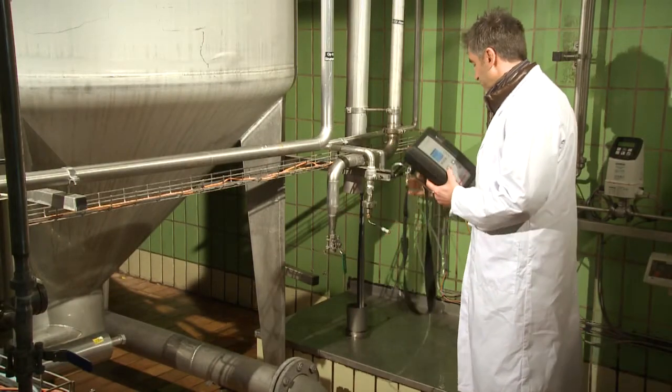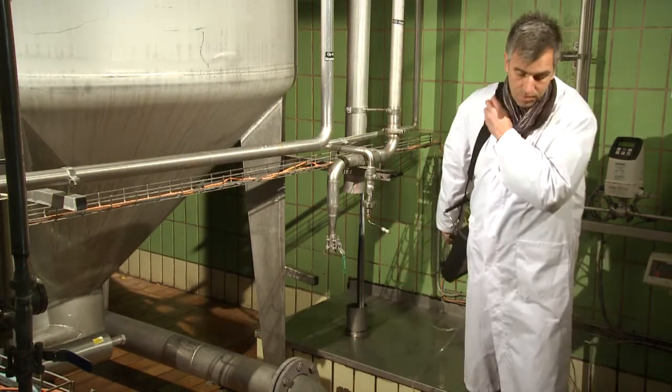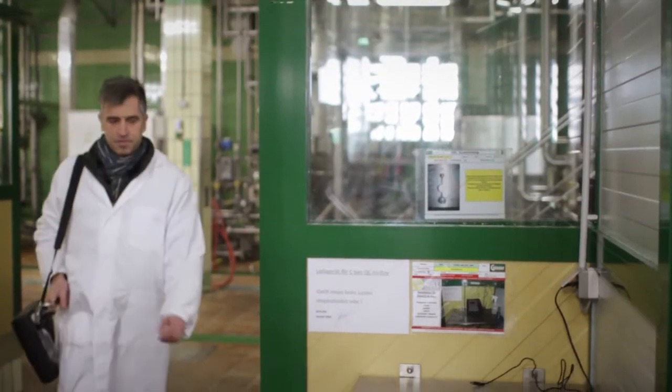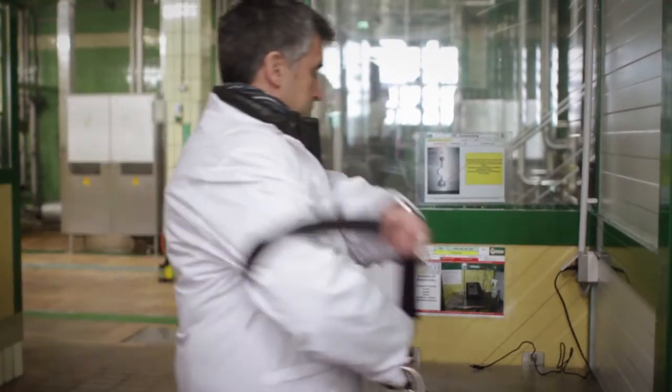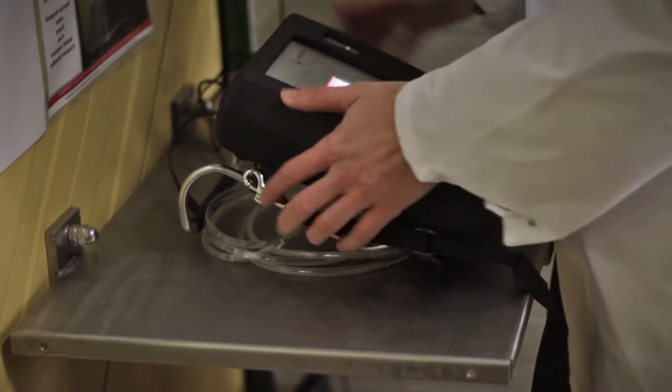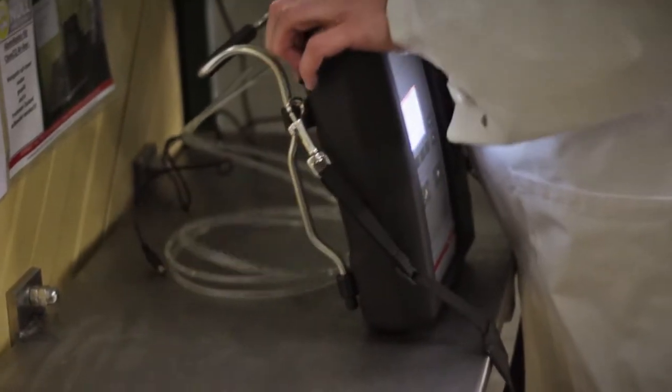Now that your instrument is correctly rinsed and cleaned, simply keep it close to your process environment, where it can recharge and get ready for the next shift for you.